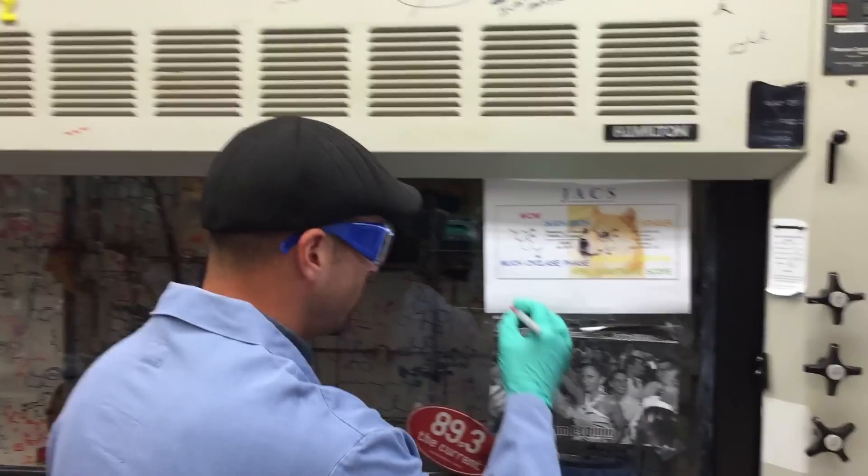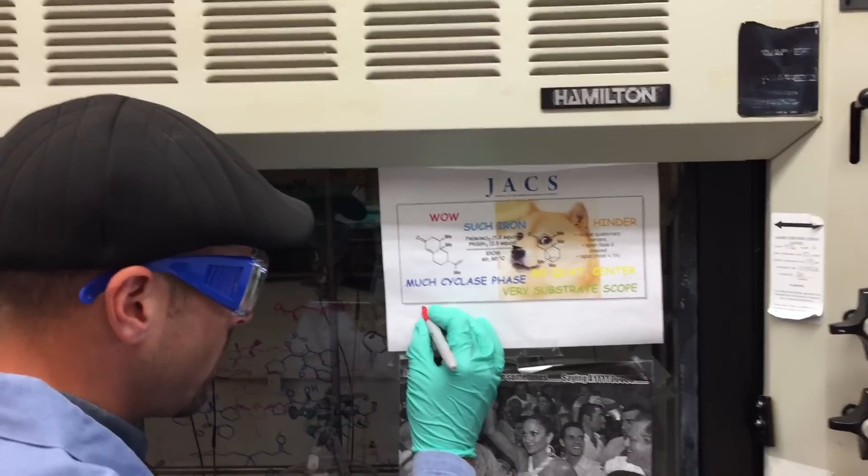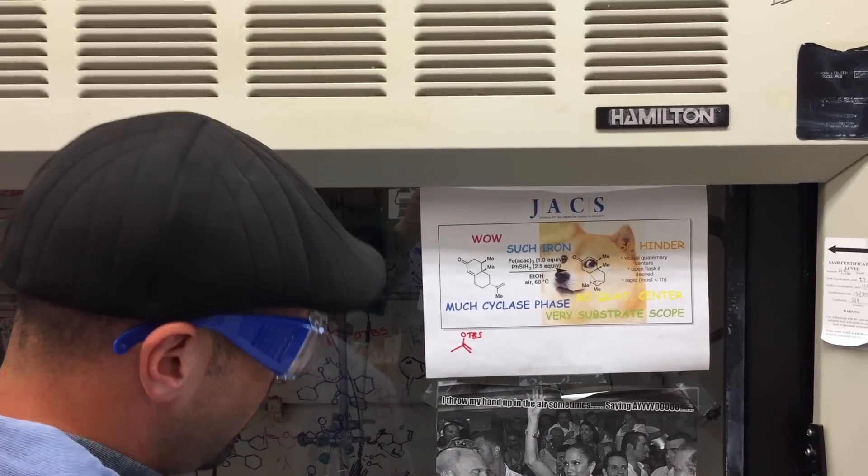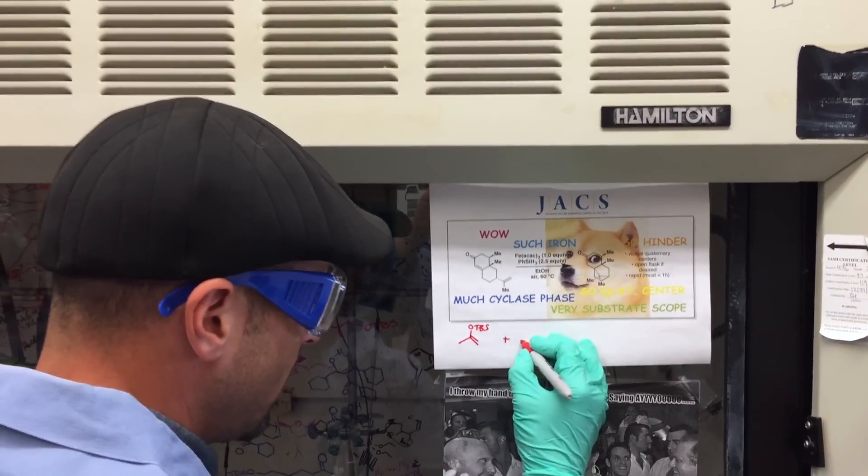Okay, so these guys have convinced me to run this reaction myself. This is a reaction that even your PI can run. Today what they're going to have you do is make a quaternary center. Not an all-carbon one, but nevertheless a quaternary center.